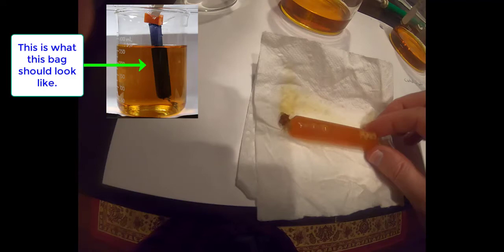For our purposes, we're going to pretend like the bag has starch in it. So we're going to record the color as dark purple. Now I will tell you that starch is too large of a molecule to move through the pores of the bag, which is why we see a brown color still within the solution of the beaker, indicating that no starch has moved through the bag walls.